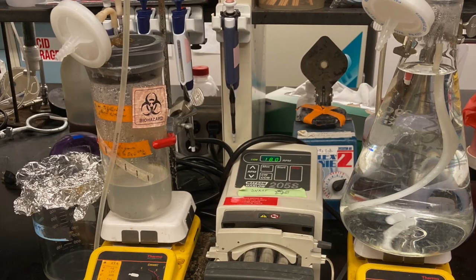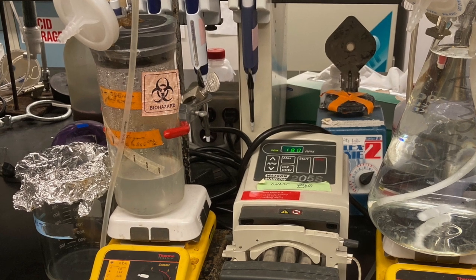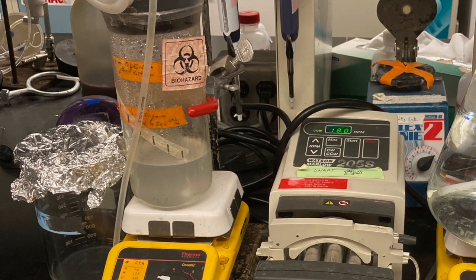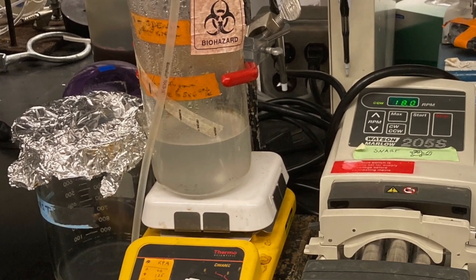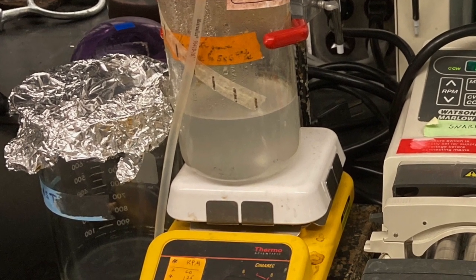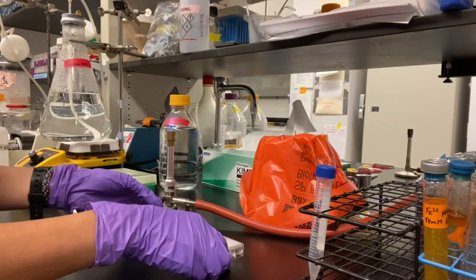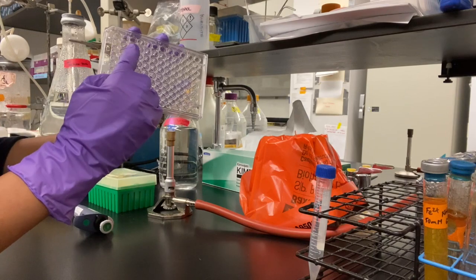The spot plate is begun by taking the OD600 reading of triplicate samples of the initial stock of Pseudomonas bacteria. We take the OD600 to draw a relationship between the OD and the concentration of bacteria. First, we are going to take 200 microliters of the stock solution and pipette them into wells A1, A2, and A3.